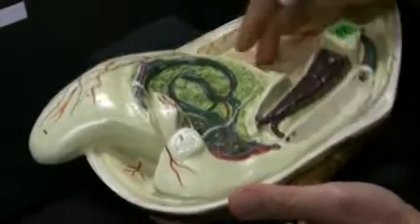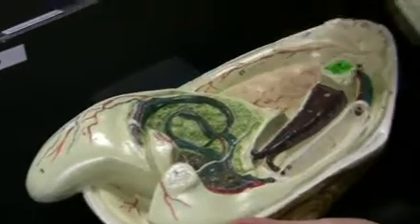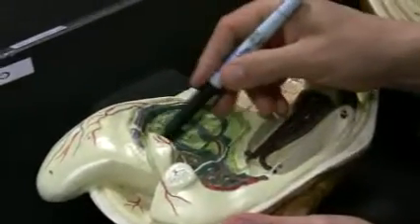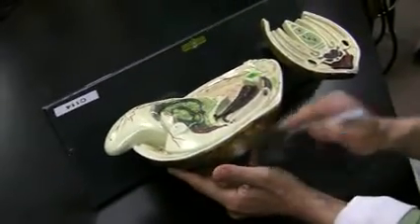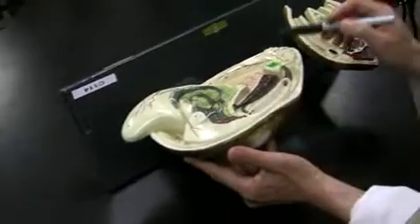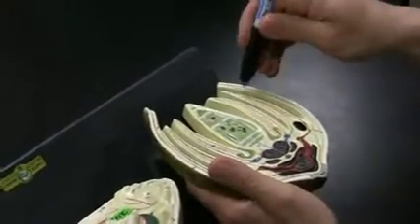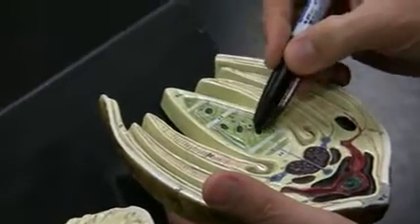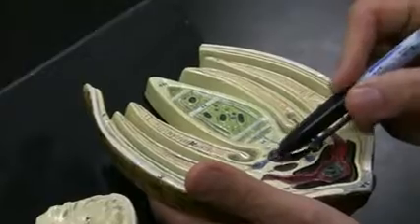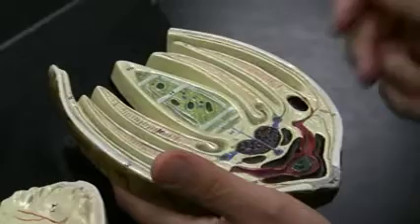Kidney. Gills, mantle, thank you. Stomach, and the white things they're showing in here, they are nerve. Okay? Umbo, adductor muscle, anterior adductor muscles, posterior adductor muscles, and this is palp. Cross section of it, you do have slide of this. Mantle, gill, mantle, foot, intestine, gonad, kidney, heart. Right here, intestine passed through the heart.